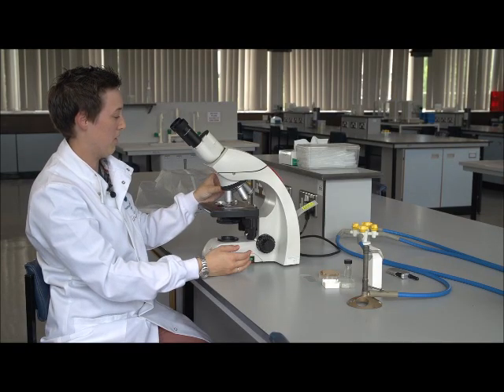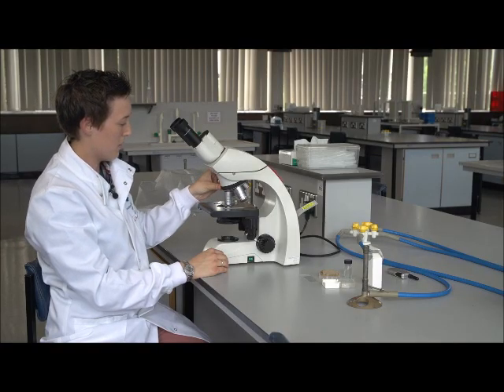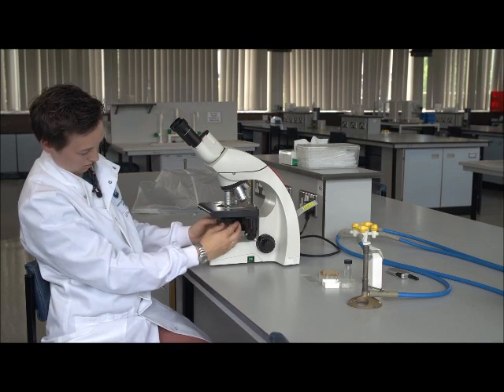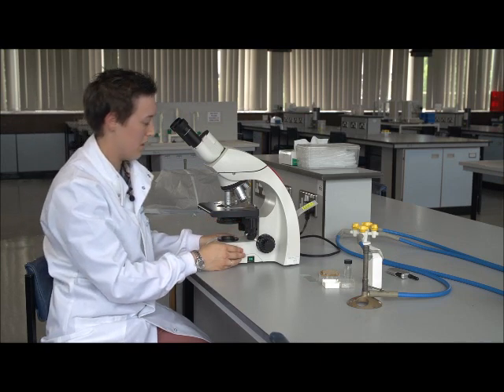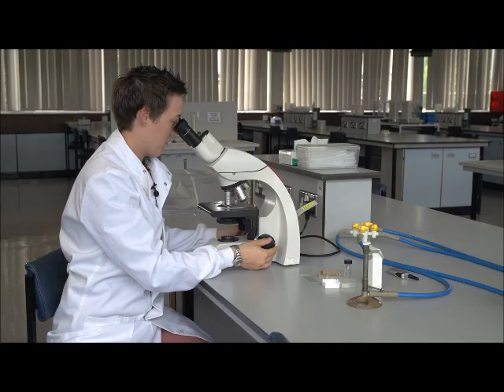Okay, and again we can work our way up through the magnification. So 10 times, small adjustment on the focus to find our sample again. We can go to 40 times, and we can add the phase as well and increase our light again if we'd like to see these in phase contrast. And again, a small adjustment in focus.